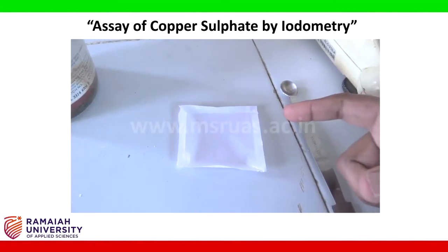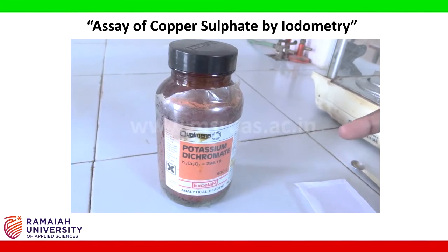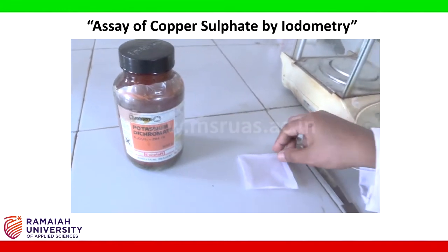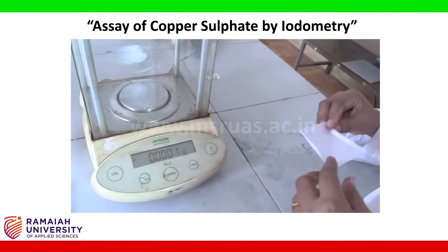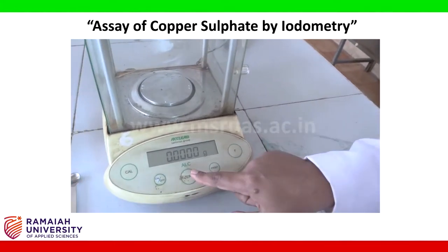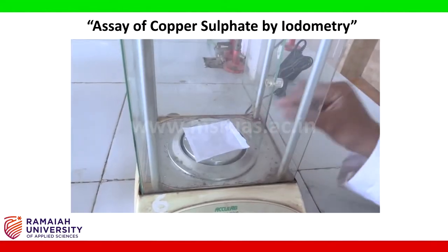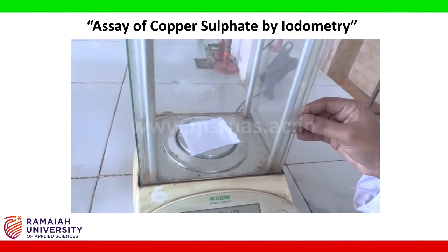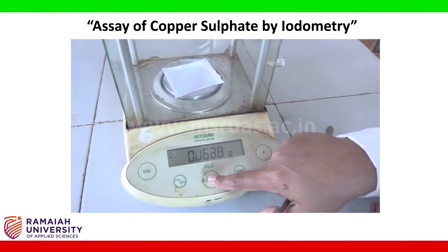Take the butter paper and weigh 0.49 grams of potassium dichromate. Tare the balance to 0. Tare the paper weight to 0.